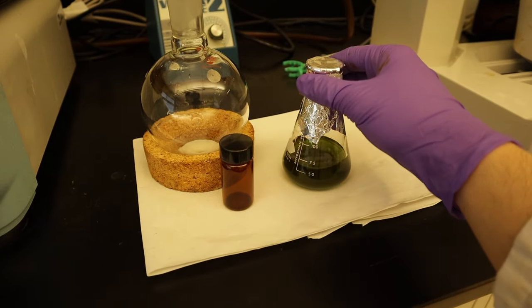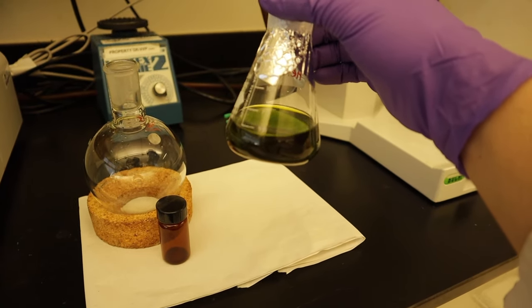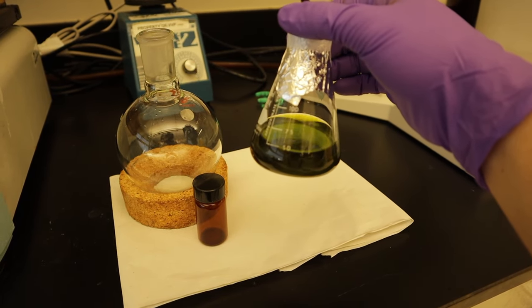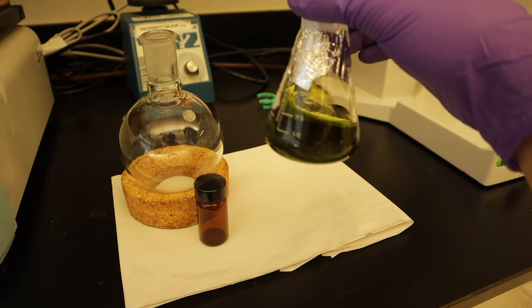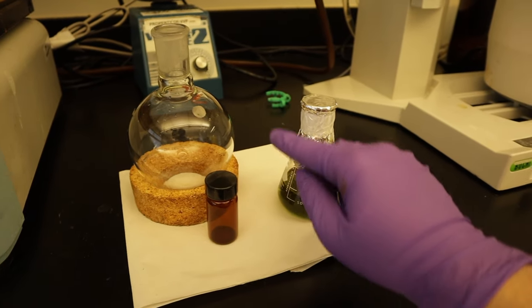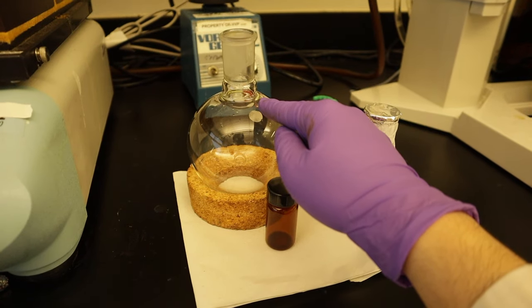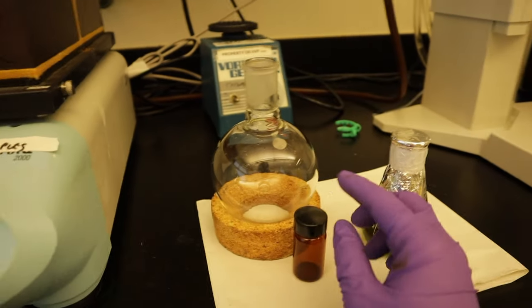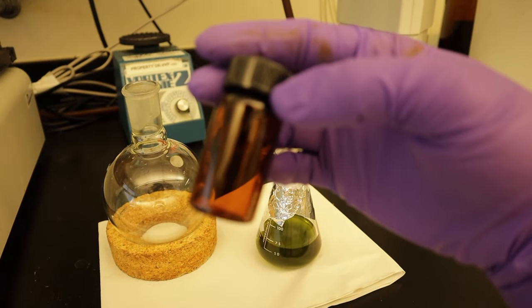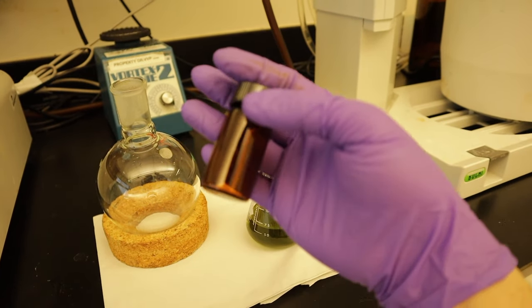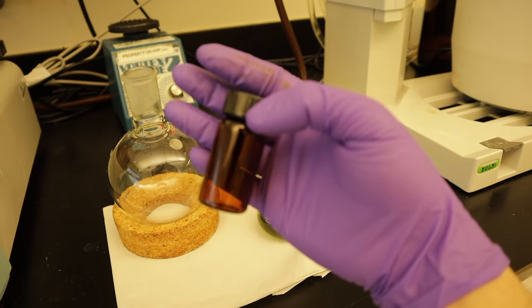The solution is composed of the solvent plus all the compounds soluble in this solvent. We'll be transferring this in a round flask so we can load it there. This is an amber vial which will be the container of our plant extract or the final product.